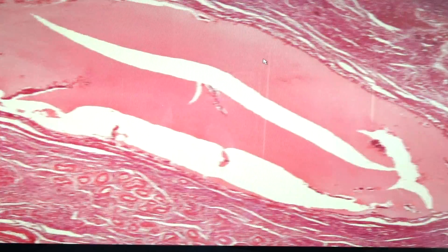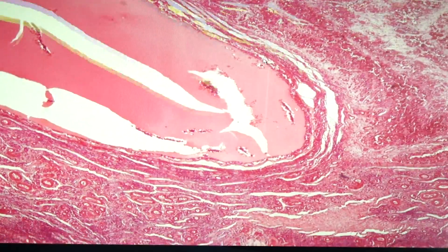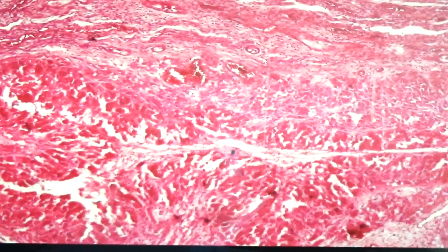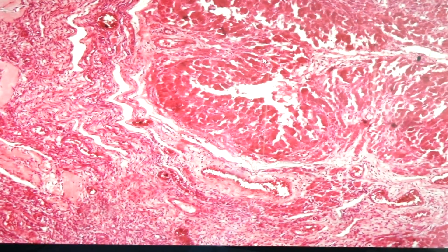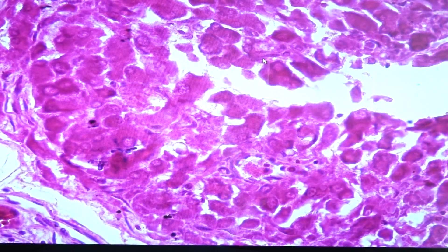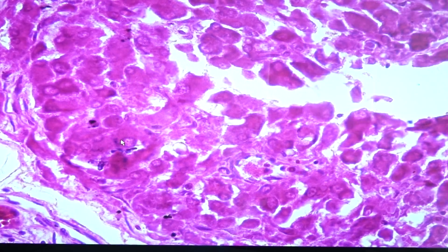In the slide you would also see large follicles — these are what we call the cystic follicles. They do not have the oocyte. There are areas here that I think are also follicles, but you have the lining to be what we call luteinized granulosa cells — they are large, large follicle cells.